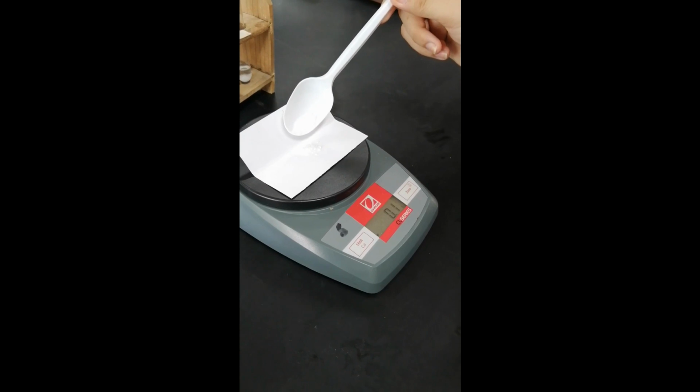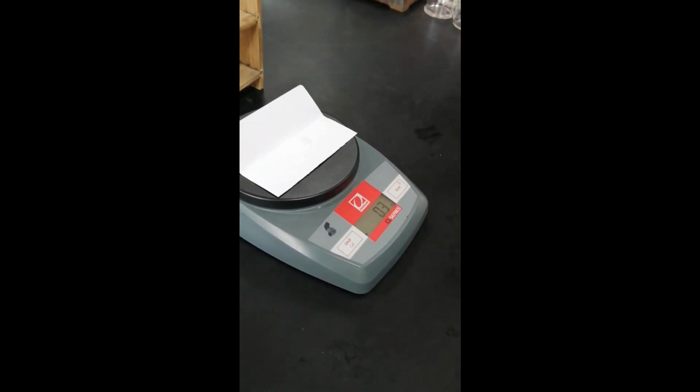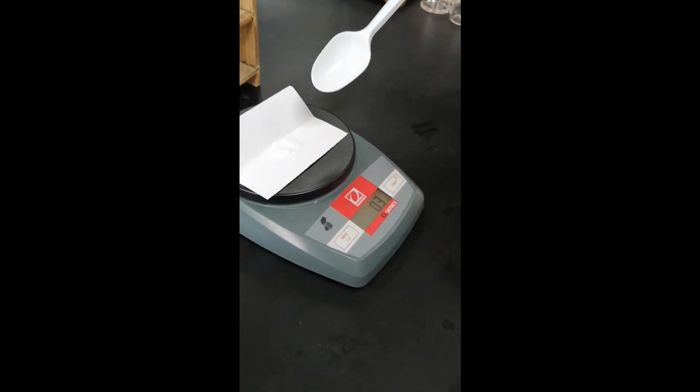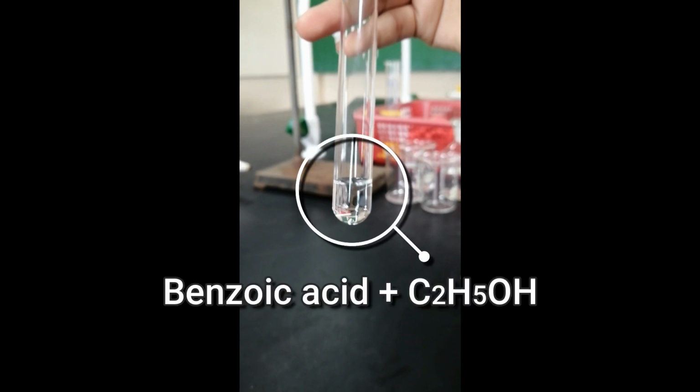Next is benzoic acid. Benzoic acid na yung nami-measure. Oops, sobra. Kailangan lang natin ng 0.2. So, yan yung final product kapag na-dissolve na si benzoic acid with the ethanol. So, wala siyang natira.